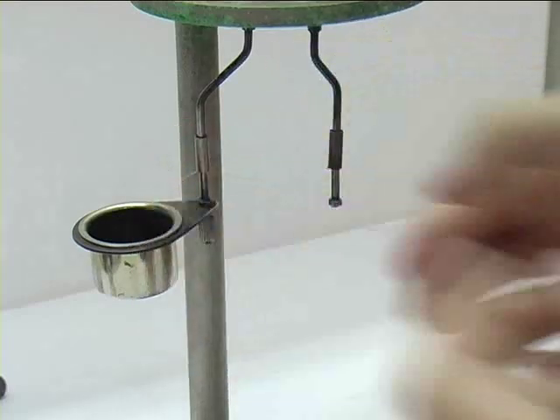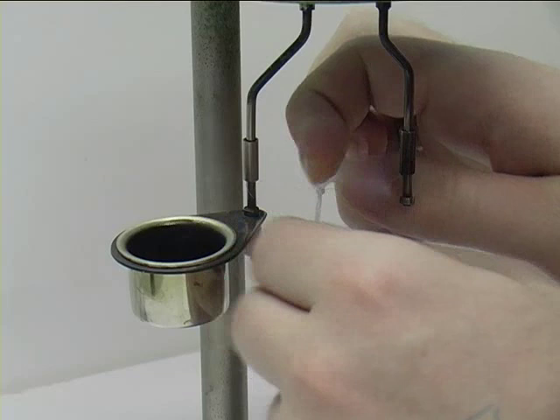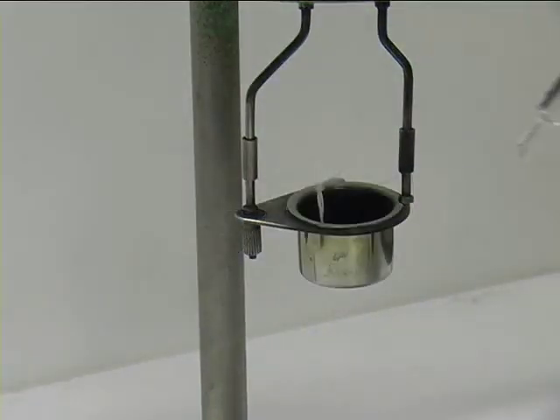A piece of cotton is then tied to the fuse wire and fed into the crucible and the liquid sample then added to the crucible.